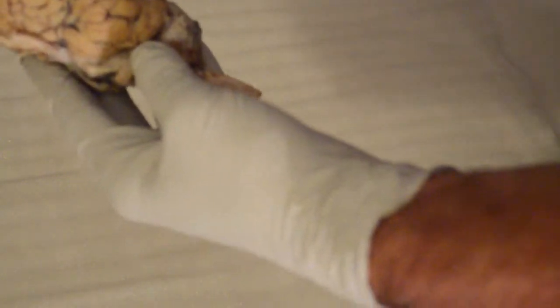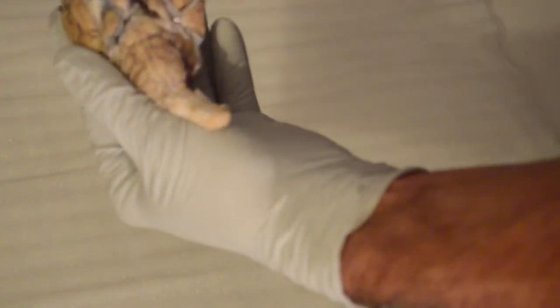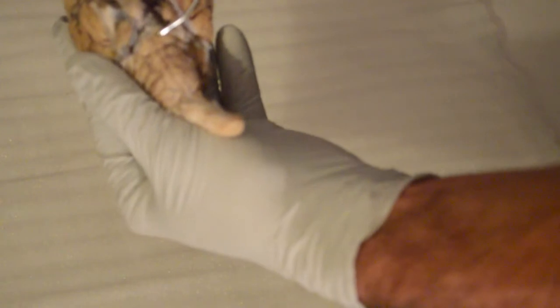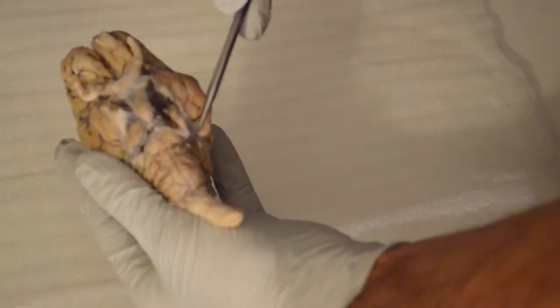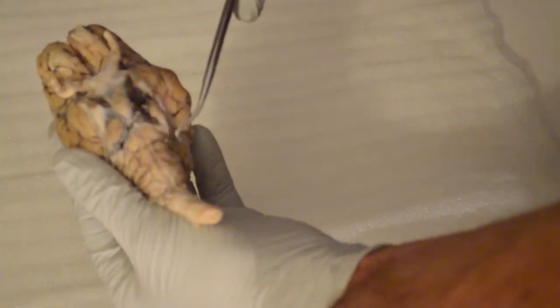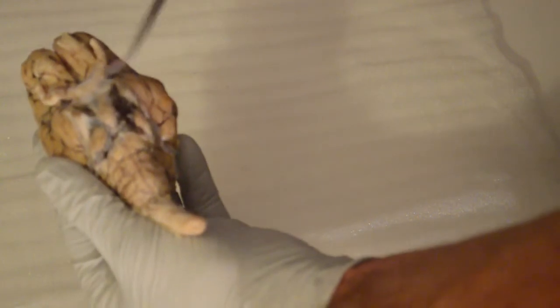Okay, moving on to the demonstration of the cerebellum. The cerebellum is right underneath the brain itself, right here. It's going to be below the pons, so the cerebellum is right here. The pons are right here. Now, the function of the cerebellum primarily constitutes balance and coordination. That's really important. And of course, the pons' function is to connect the lower half of the brain and the upper half of the brain.